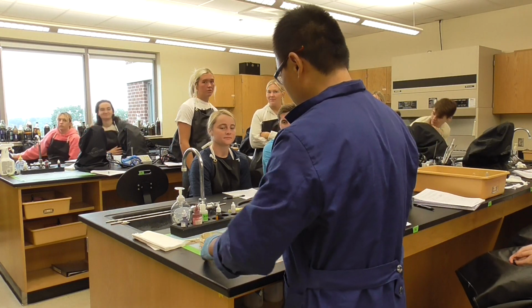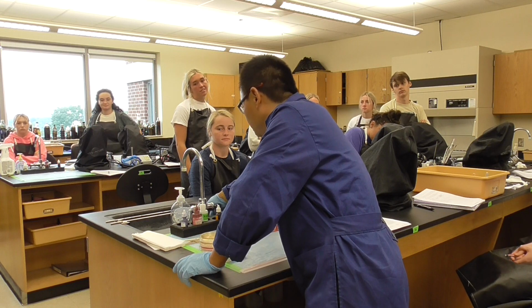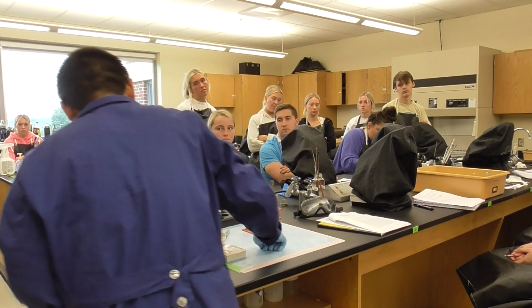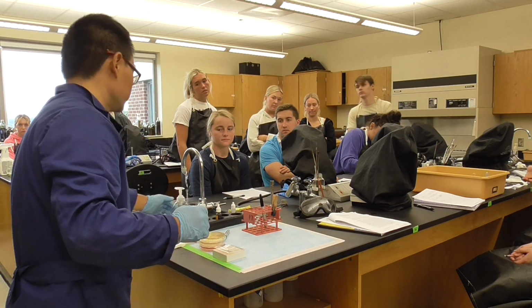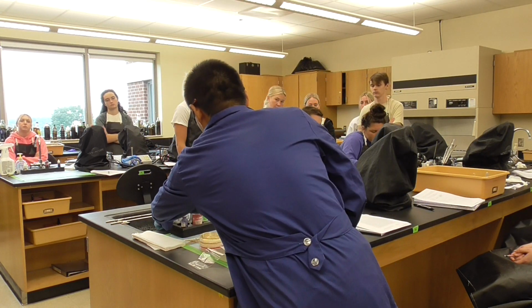Okay, so the same thing. First, we're going to check the water. The water is dripping, which is good. I don't know if you want to use cold water or hot water. It's cold water. So water dripping is good. Always check. Let it drip a little bit. So we're going to add it a little bit.